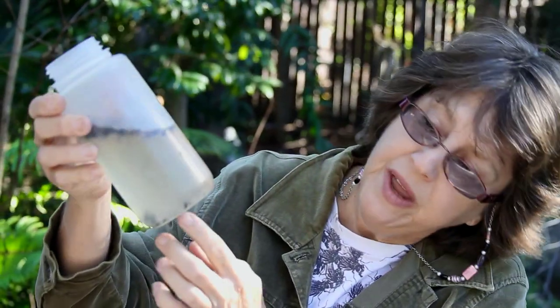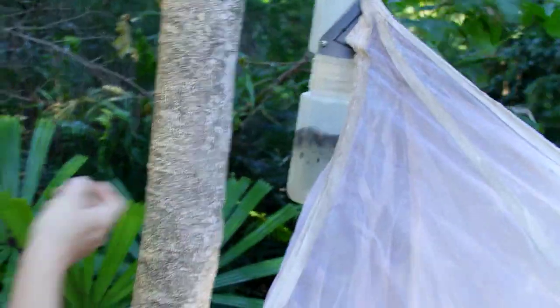For a preservative you can use ethanol or you could use metho. Or for a longer term sample you might be using propylene glycol. In this sample there is already a label that I placed in when we set the trap up. I'll add another label today as I take the sample out. Those labels will put the dates down, the location including a GPS location if we have that data, and also the method. That is most important — the method that you have collected the sample by, because afterwards you cannot tell, as it's just a group of insects sitting in preservative.